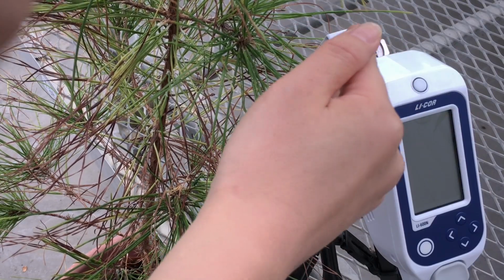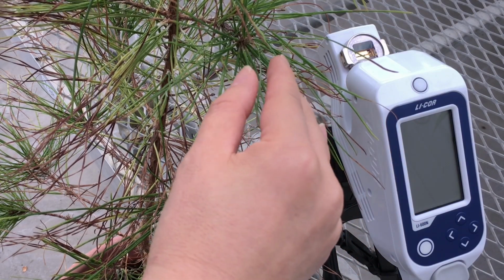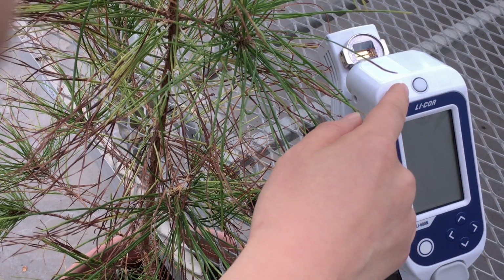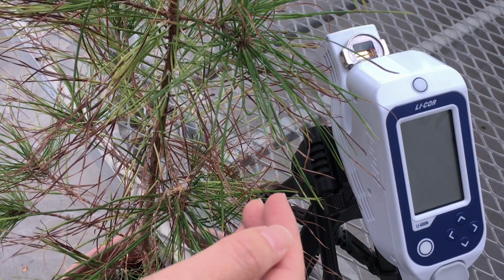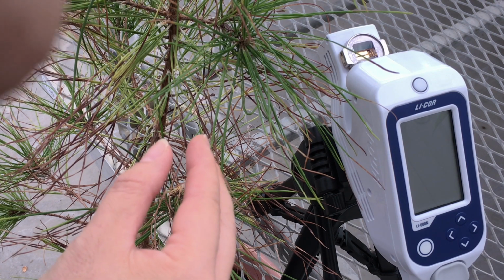Otherwise, your leaf will respond to that new light level immediately, especially your fluorescence data, phi-PS2. And also make sure you don't shade the external quantum sensor, like by yourself or by other leaves. Otherwise, the external light level being measured will not reflect the light level your leaf is experiencing.